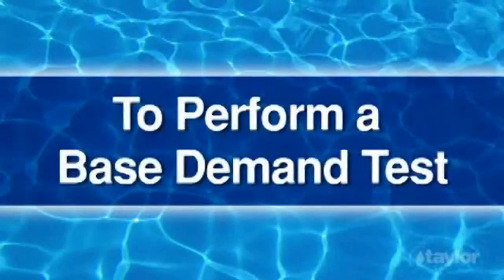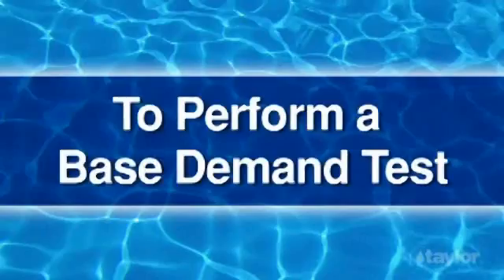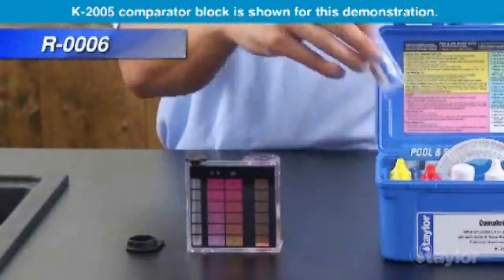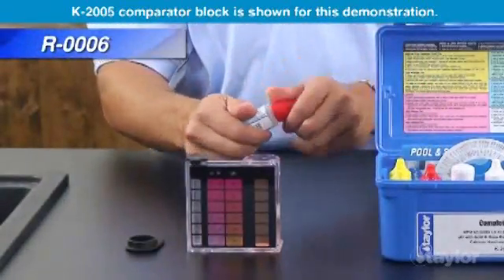To perform a base demand test, use the treated sample from the pH test.